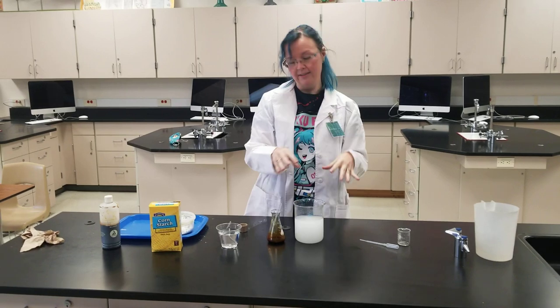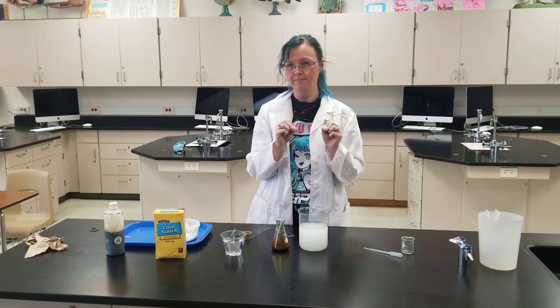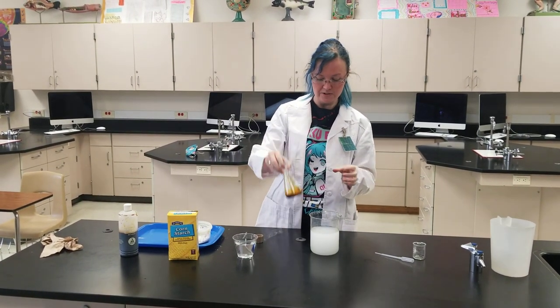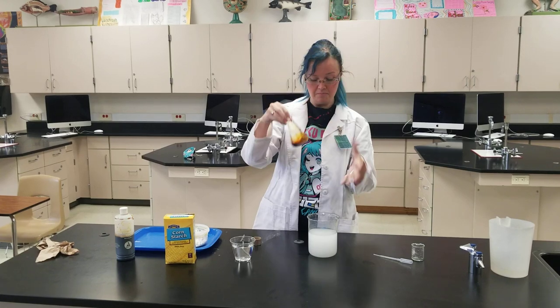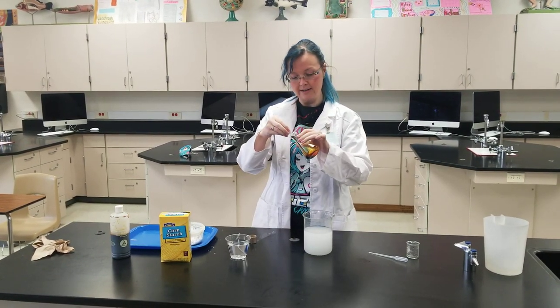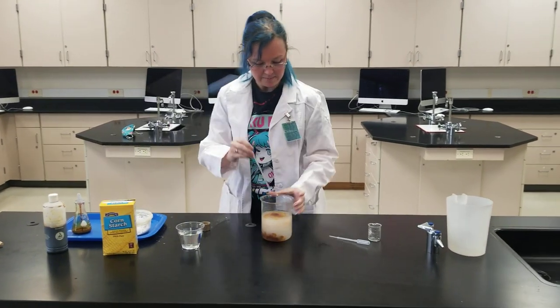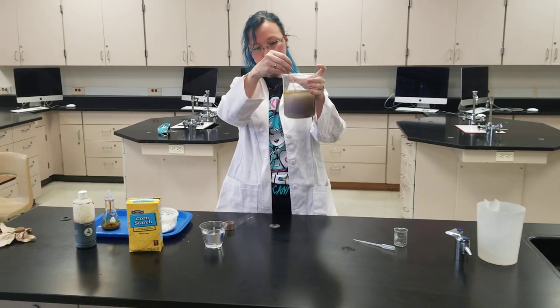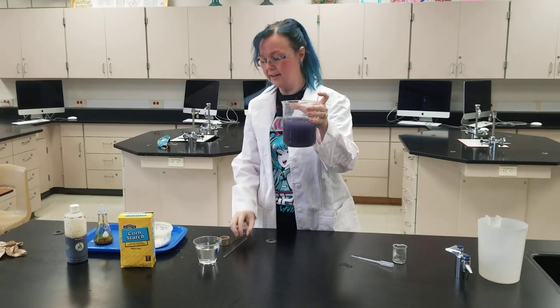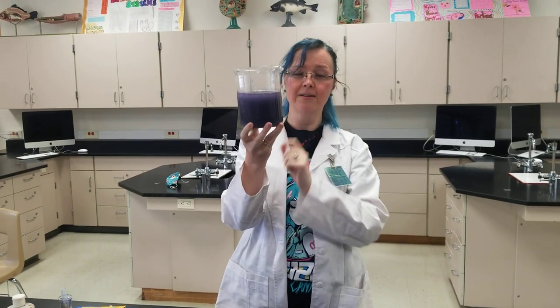So I want you to think about it — if I add this to the starch solution, what do you think is going to happen? Hopefully you're thinking a color change is going to happen. Maybe it's going to turn the color of the iodine, or maybe it'll stay the same color. So let's see what happens. I'm going to add some of the iodine and then mix it up. You'll see that our indicator solution has indicated that we have starch because it turned this pretty purple color.